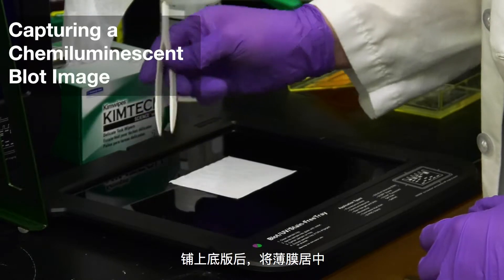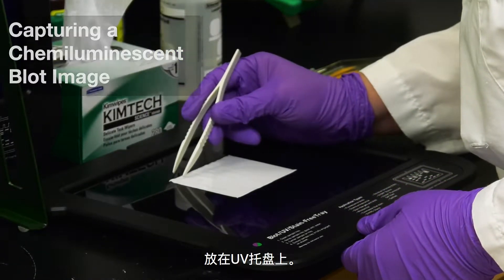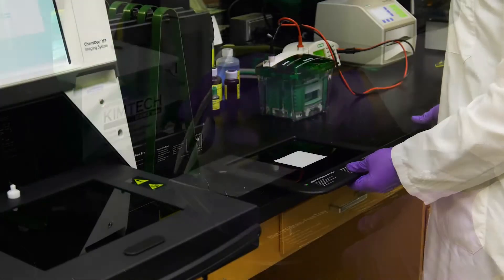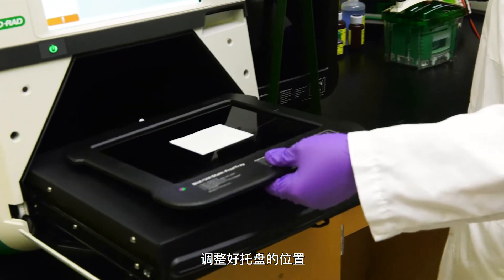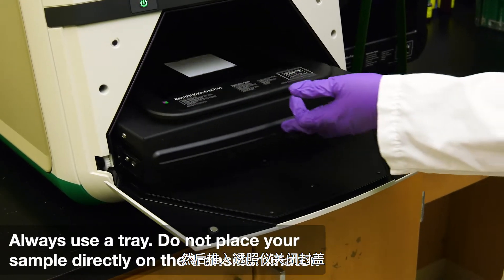After applying your substrate, center your membrane on the UV tray. Once you are satisfied with the position, push the transilluminator back in and close the drawer.